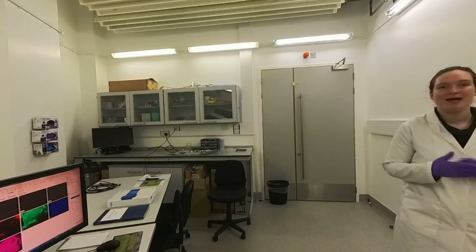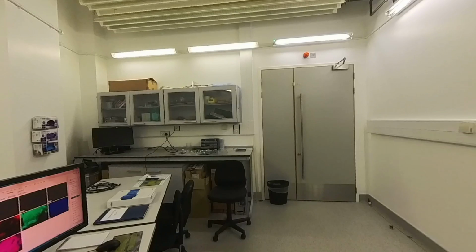So my name's Rowena, and this is our Scanning Electron Microscope, or SEM for short. A scanning electron microscope uses electrons to look at nanoscale and atomic scale features, so really, really small samples. We use an electron microscope instead of a typical optical microscope, which you might have used in school already, because electrons help us to look at much smaller features which are completely invisible in an optical microscope because they're just way too small to see.